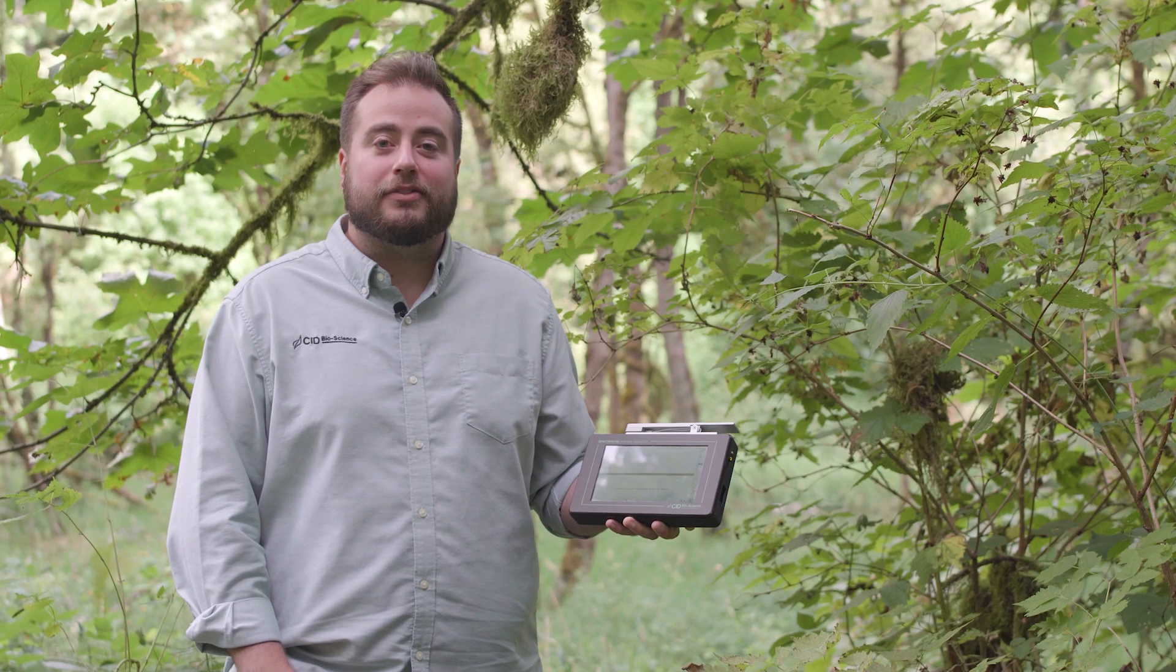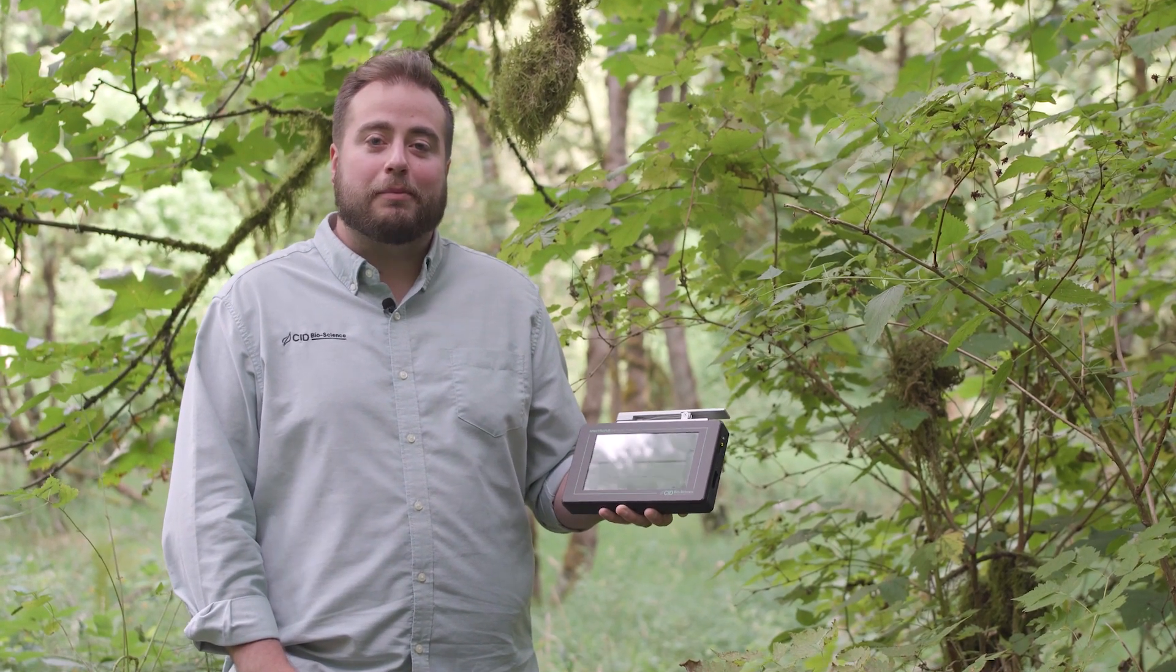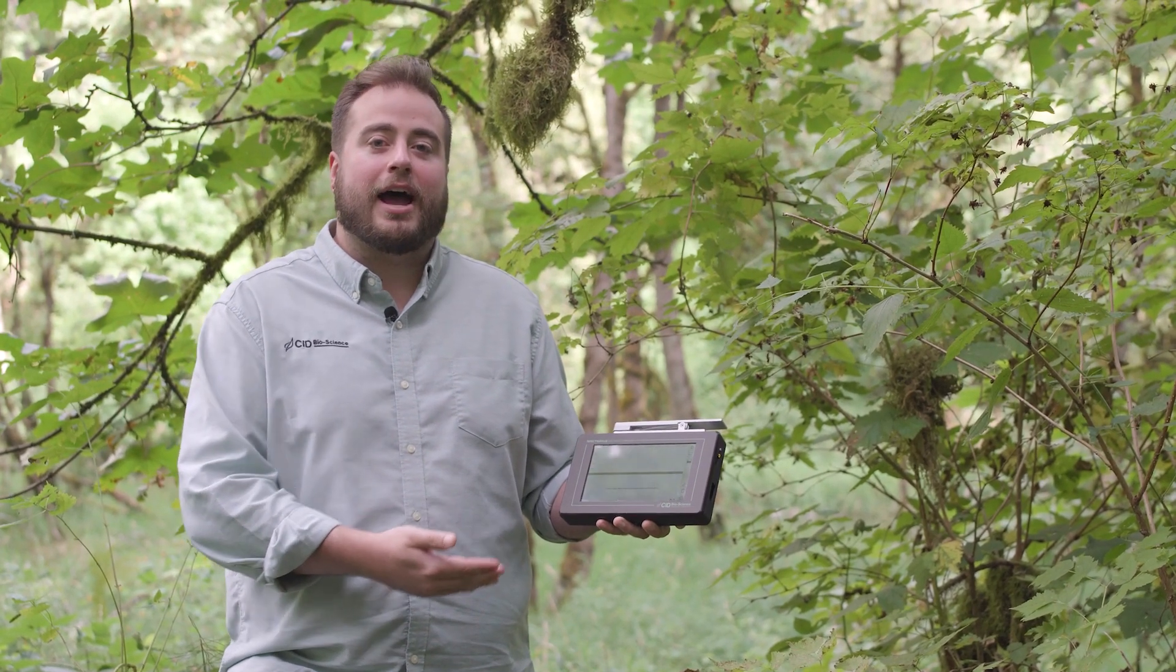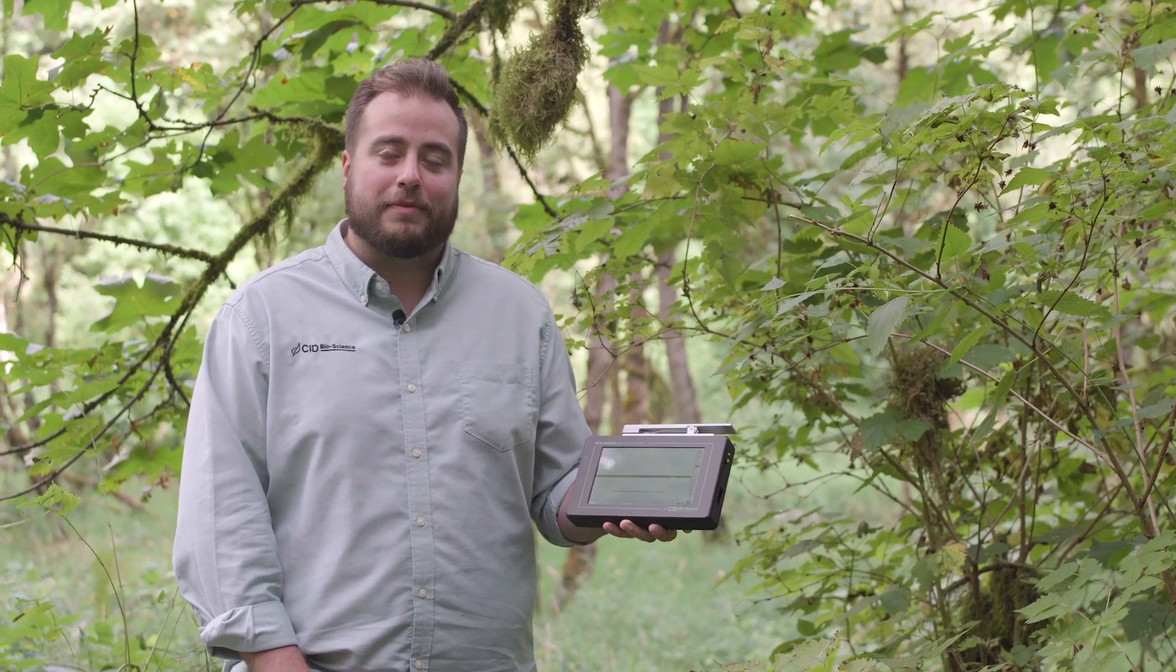So now we're out in the woods outside of our headquarters in Camas, Washington, and I'm going to demonstrate to you how to take a measurement and then how to visualize the data output from that measurement.